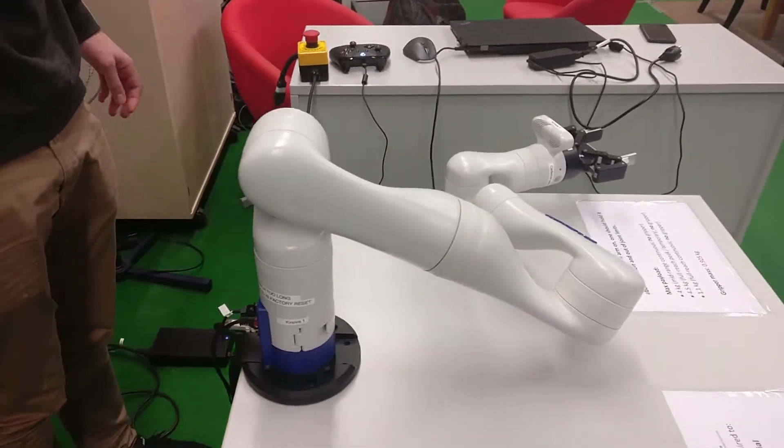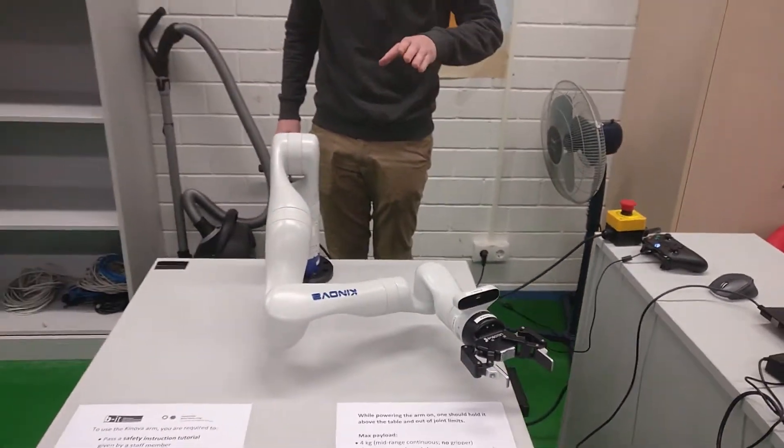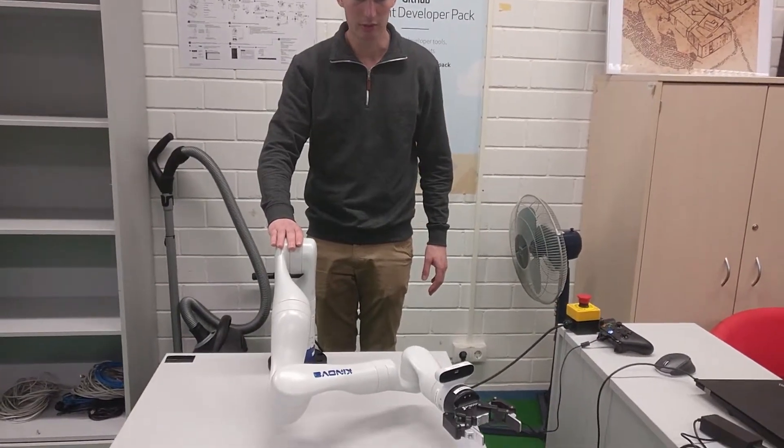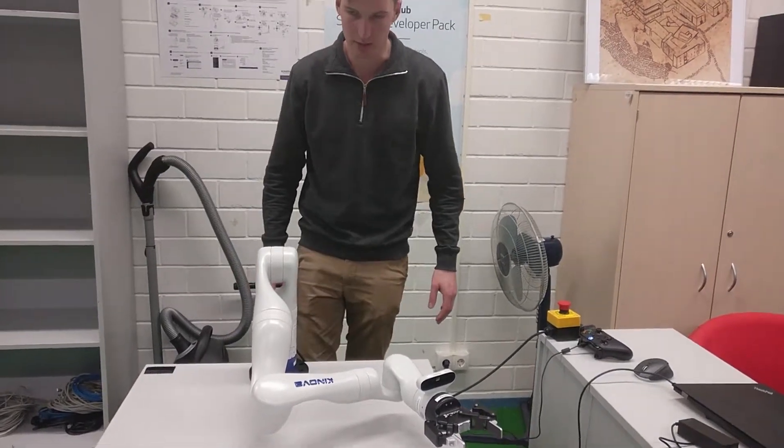If you're going to need to turn off the robot in emergency, just press the emergency stop button and the robot will power down. There are passive mechanics in the arm itself to slow the drop, but you still need a catch to make sure no damage is done to the arm or the table.